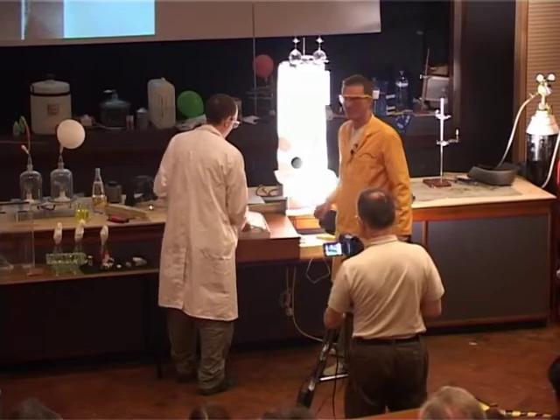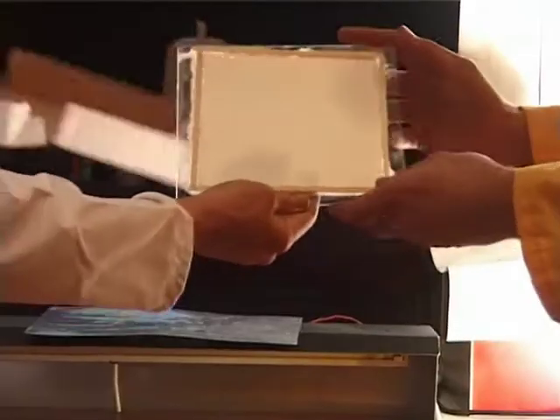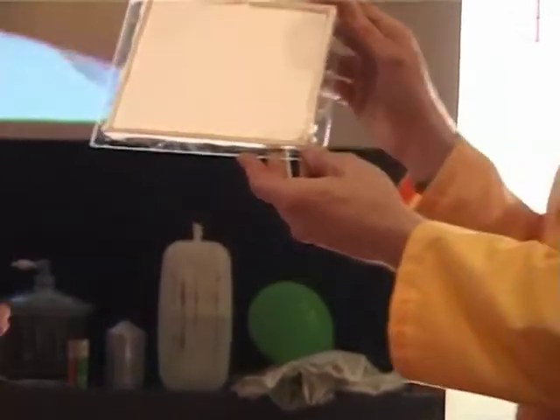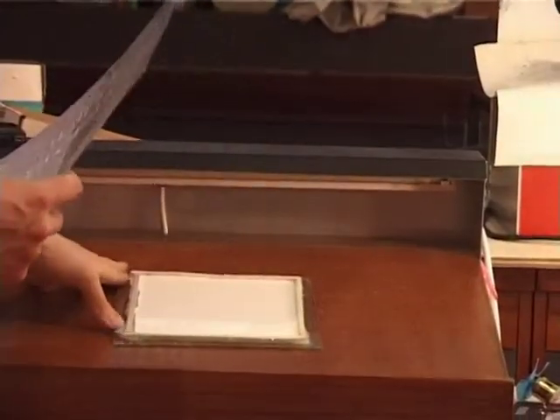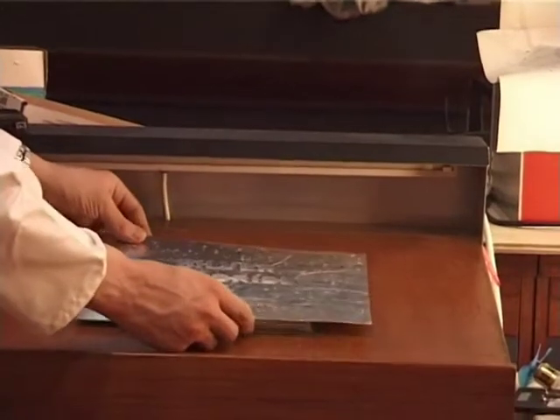We have here a plate. We've made this with some jelly and some silver chloride. And at the moment, this is a nice white colour. Now, we're going to put a mask over this and shine some light on it.